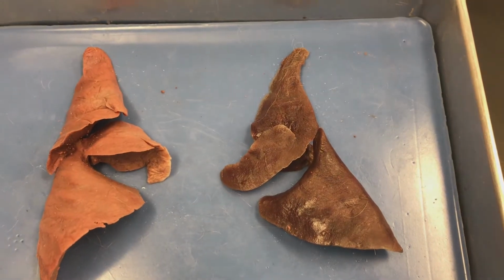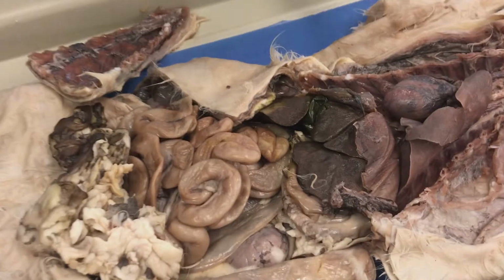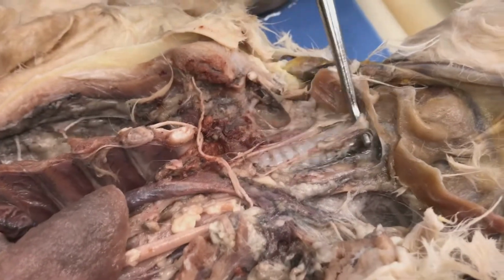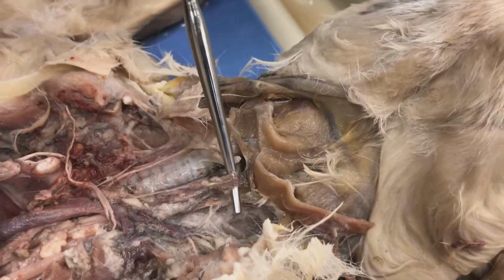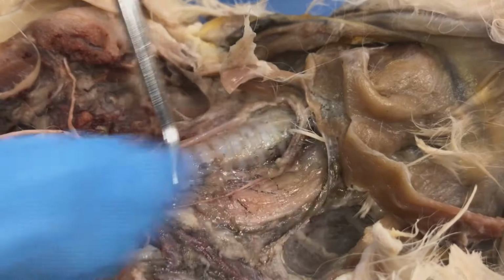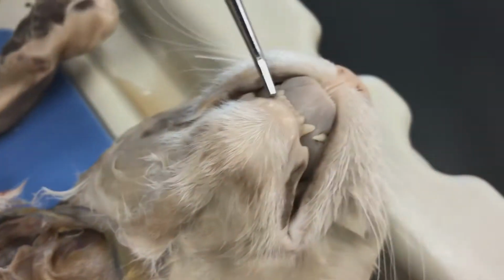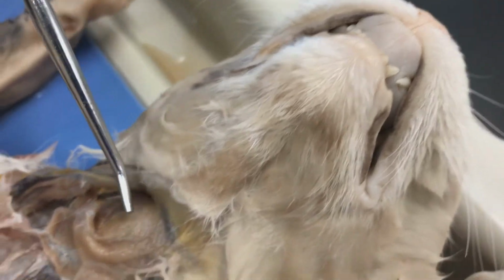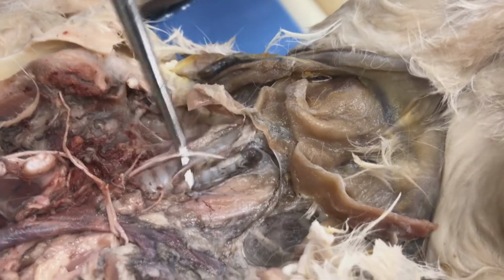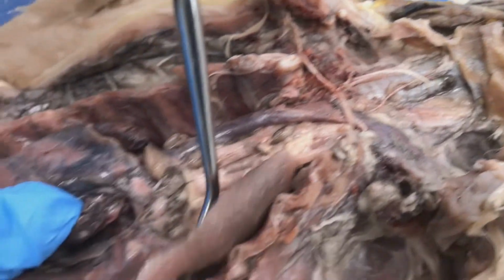The other part of the respiratory system we want to see on the cat is going to be the trachea up through here. So the trachea is here. It looks like a washboard with the cartilaginous rings all throughout here. And it goes from the mouth, curves down, and then it becomes a trachea if you get past the pharynx. And then from there it goes and feeds the lungs.